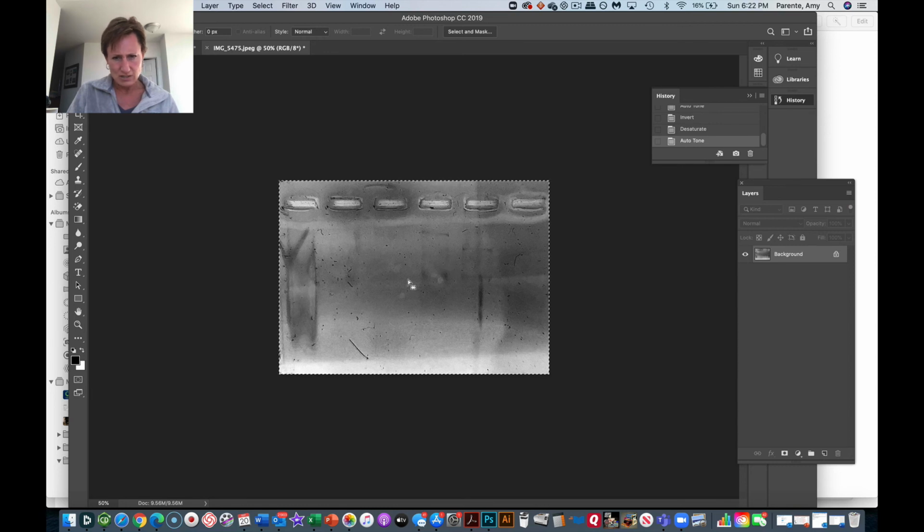Now, one of the things that I don't necessarily like about this gel is I see that same band there. This is definitely plasmid. When plasmid gets cut and nicked, we see something that runs a little bit differently, but I don't necessarily like that I see that same band here. But again, the key to this lab was not necessarily to end up with a picture perfect gel. It was more teaching you some techniques here.